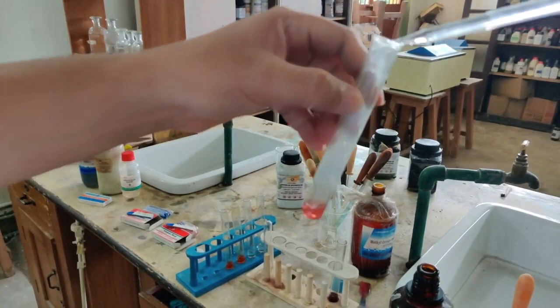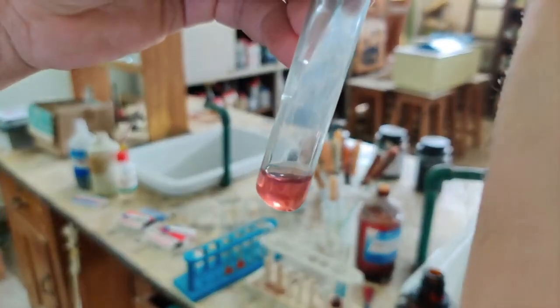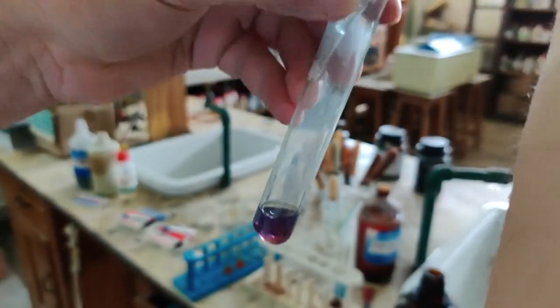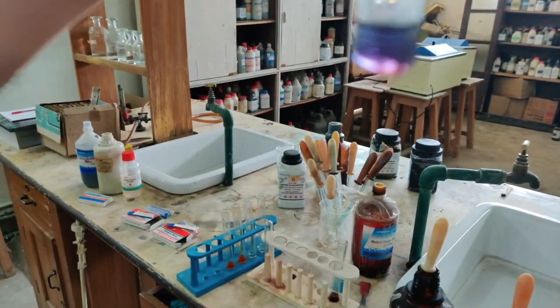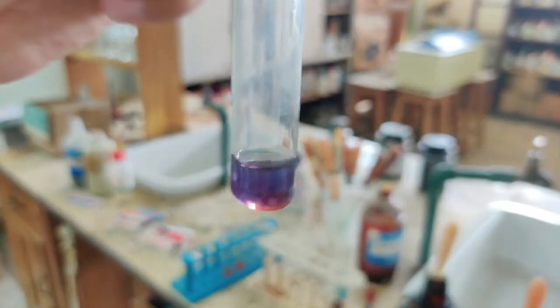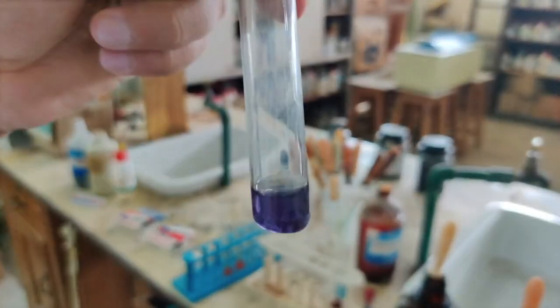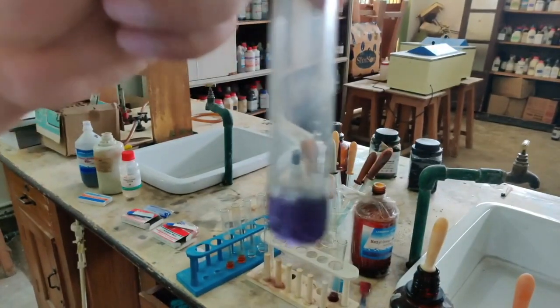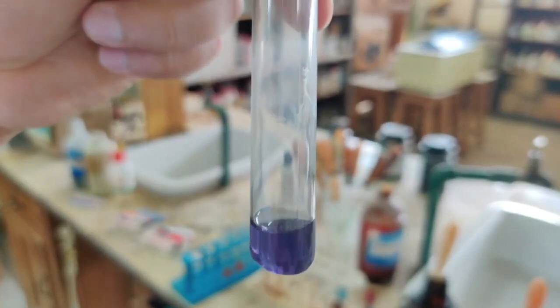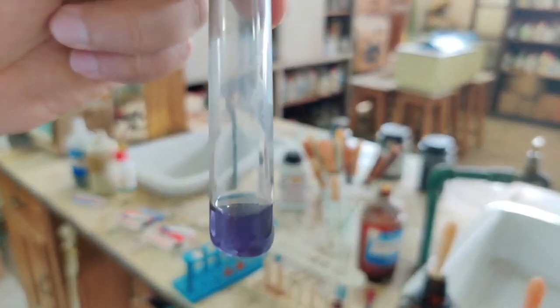Now see the color change that will be noticed. See very carefully. There I am adding. Just 2-3 drops is what I have added. Just by the addition of 2-3 drops, see how the color changes. If I shake it, the whole solution is turning blue. So a blue litmus turned to red and a red litmus turns to blue. Now a very nice blue is what it has turned to.